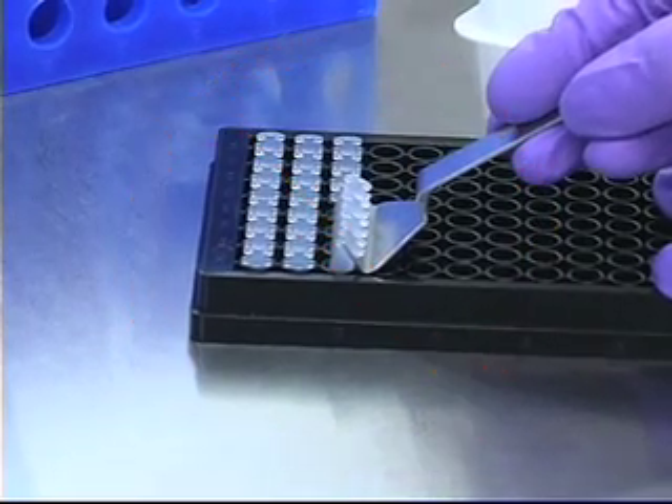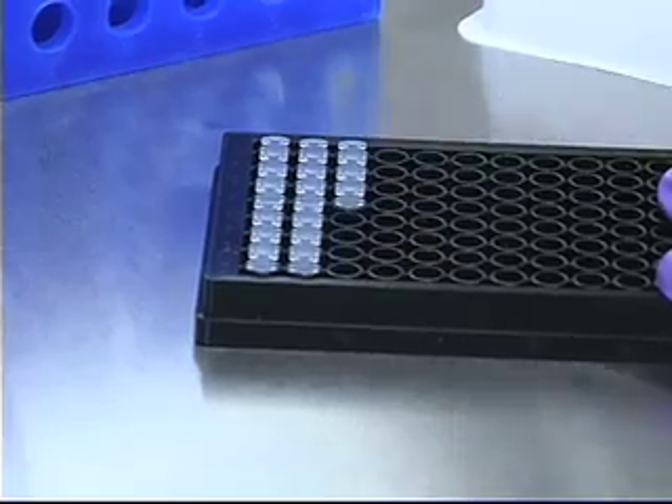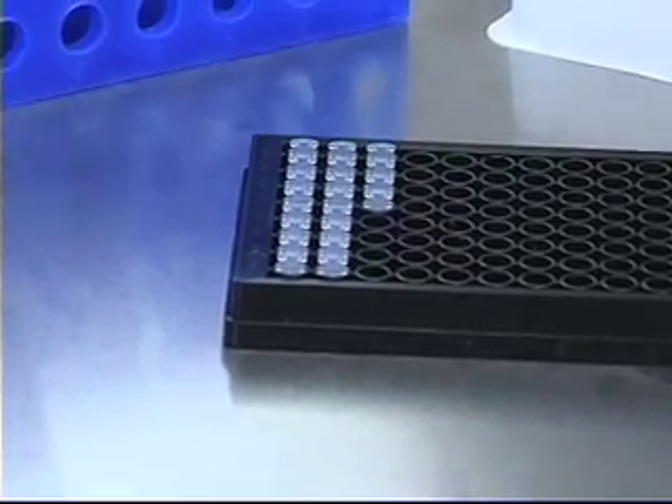For reference purposes, leave several stoppers in place in order to establish time equals zero for the migration process.